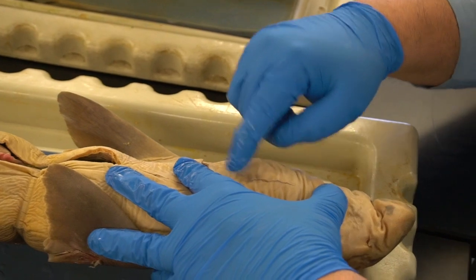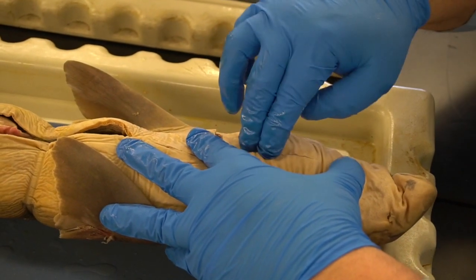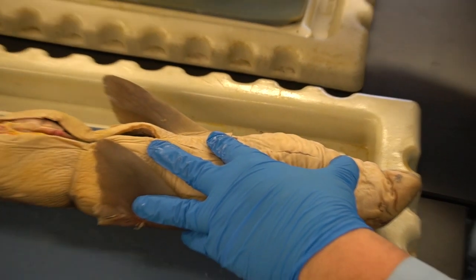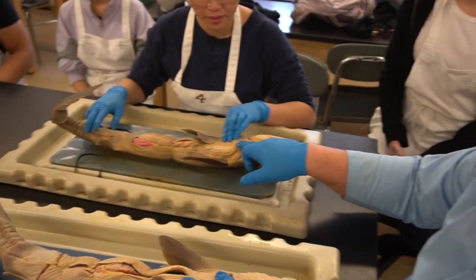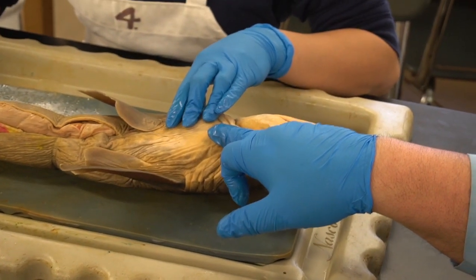Right underneath the ventral surface here, there is a piece of bone, it's actually cartilage, that protects the heart. If you feel on this specimen, you'll feel that there's a hard part right here. Feel that? Okay. Right there is going to be the hardest part of the dissection opening this, because that's where we have to get through the cartilage. It takes a little bit of force.